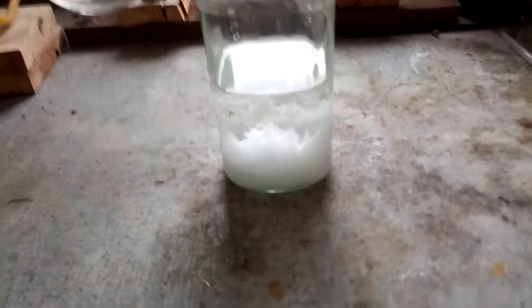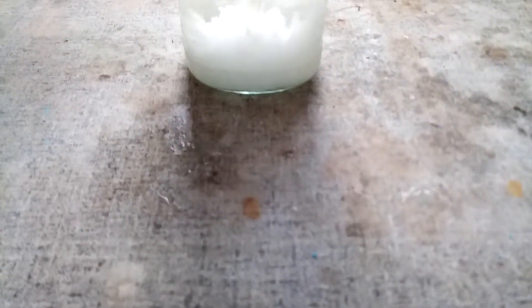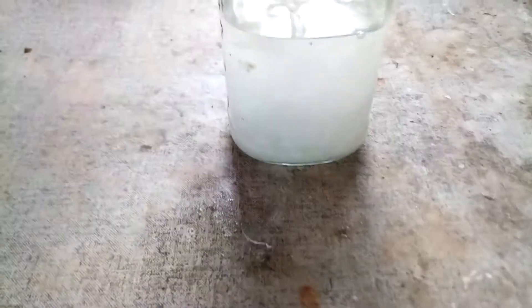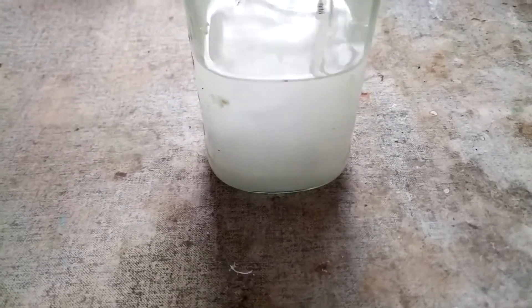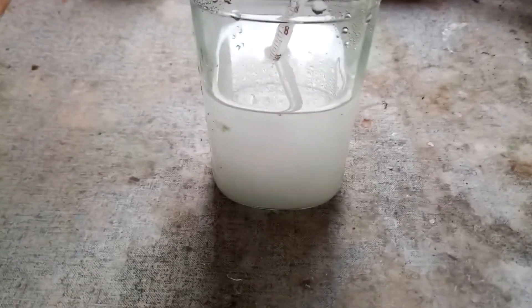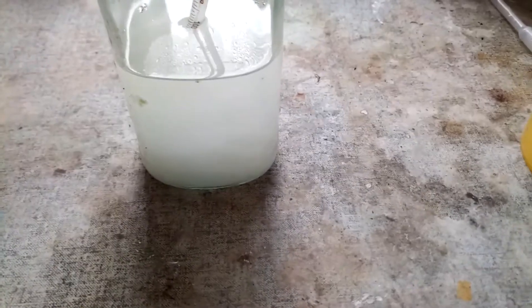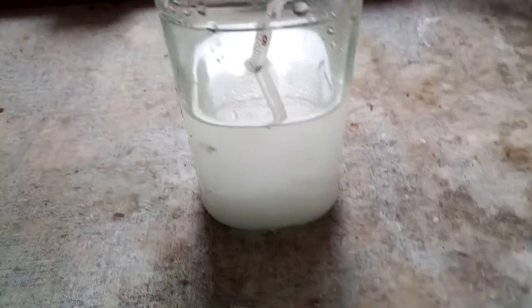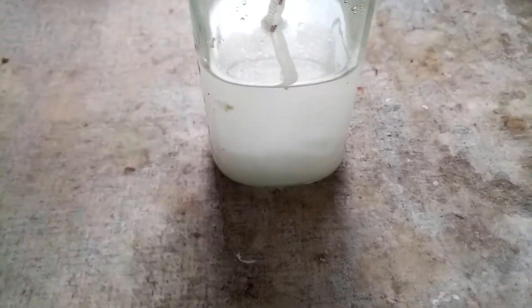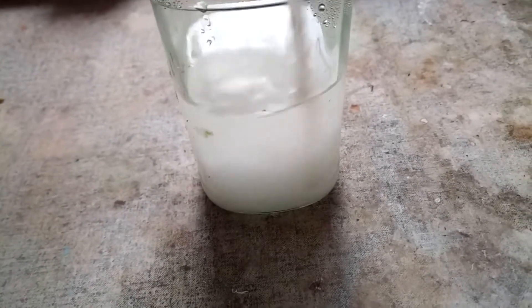Here is how it looks one day later. It has precipitated quite a whole lot of product. The next thing to do is to recrystallize this from dilute sodium hydroxide solution, because this still contains some cyanuric acid and it's pretty hard to get that out with normal recrystallization. So I'm going to recrystallize it from sodium hydroxide, and then after that recrystallize it from water just to get out all the sodium.